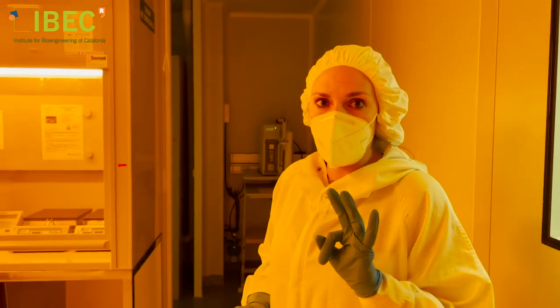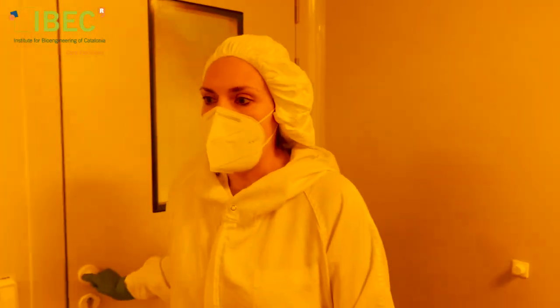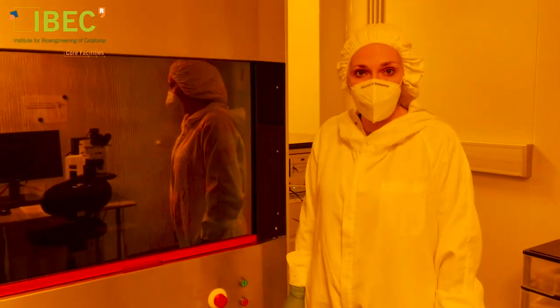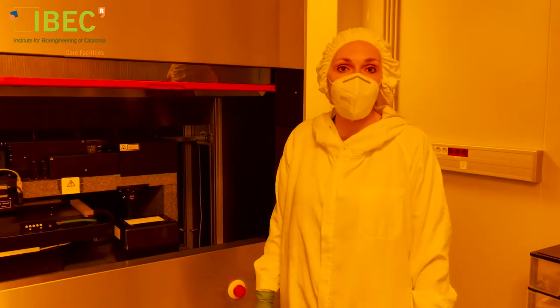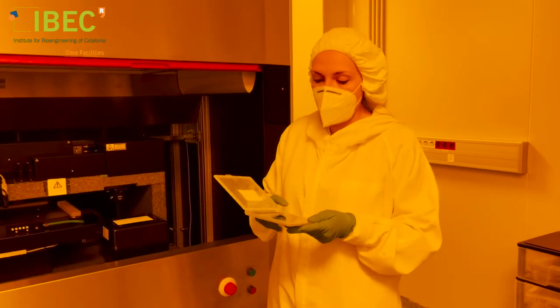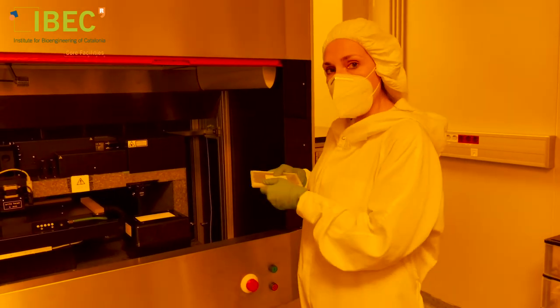This room is divided into three spaces. In the first space, we have an optical microscope to characterize the fabrication, and we also have this equipment: a direct laser writer. It is a lithography machine that has a laser as a light source — monochromatic. With this machine we fabricate the masks for further lithography processes. This is the type of thing we can fabricate, and it serves to transfer a pattern to a final device — we fabricate these chromium masks.